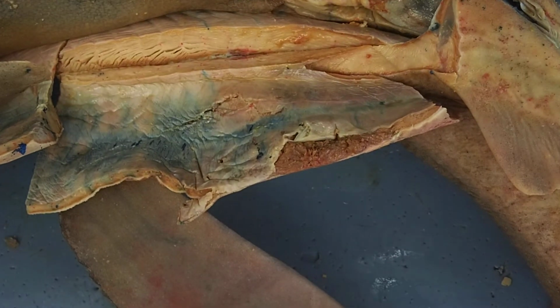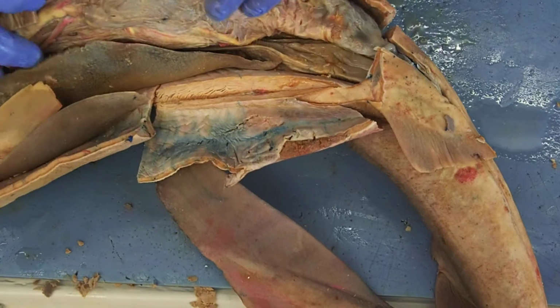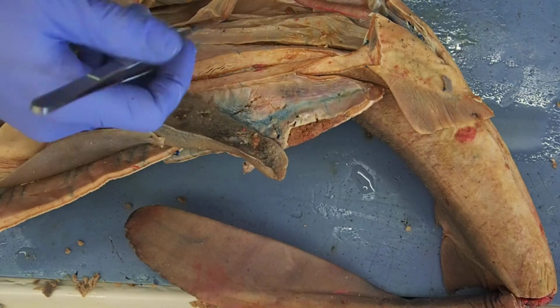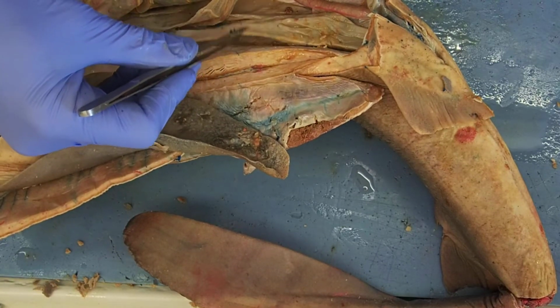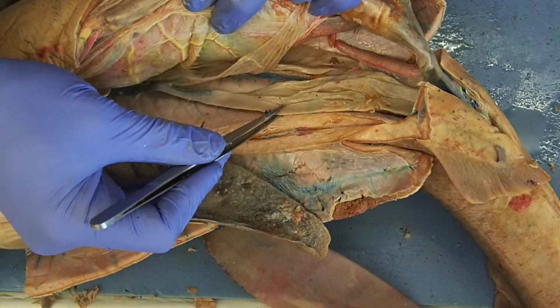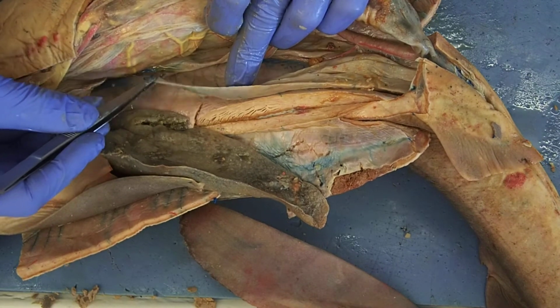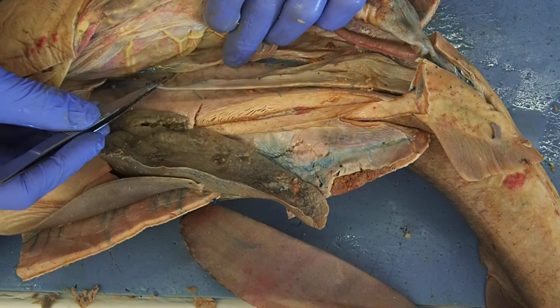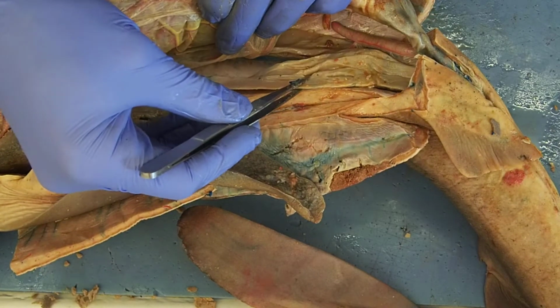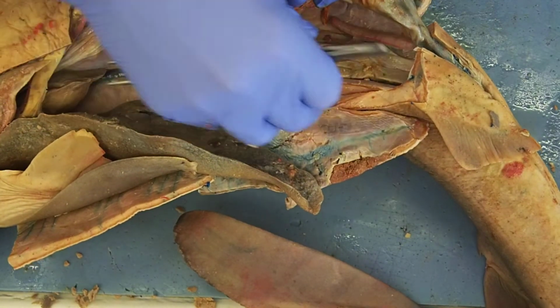Let me zoom out a little bit. That's good. And if we look back here again, we are now a little bit more ventral. We can see these structures here. Move my shark around. Okay. This up here, it's a little thinner. This is my uterine tube. Goes down and forms my uterus. Here's my uterus. It's much wider. This is just one uterus.